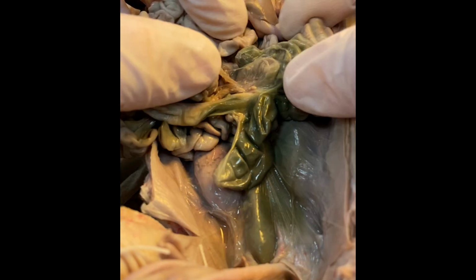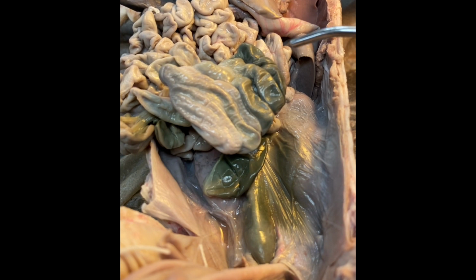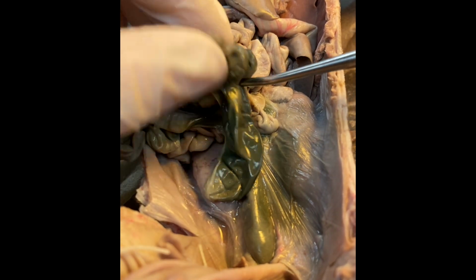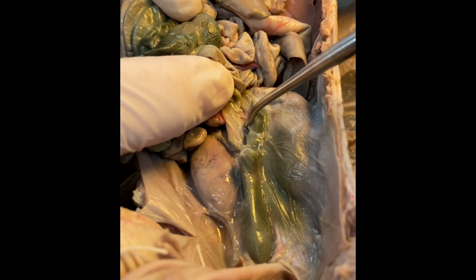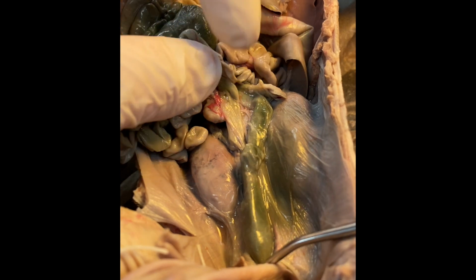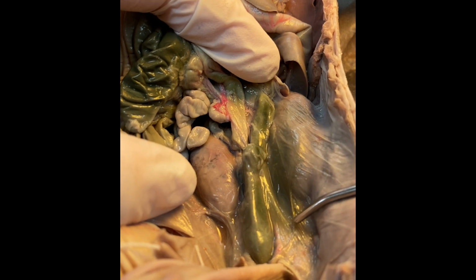Then, as we keep going, we can move into the colon, and the colon is broken into some sections just like the small intestine is. And depending on the region that you're in, it moves slightly differently, but this is the compacted area. And what I want to show you is as it wraps back around, you'll see the descending colon here, which is what turns into the rectum and comes out the anus. And this is where you get that accumulation of the fecal matter.